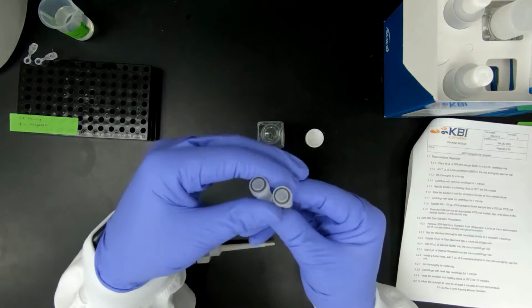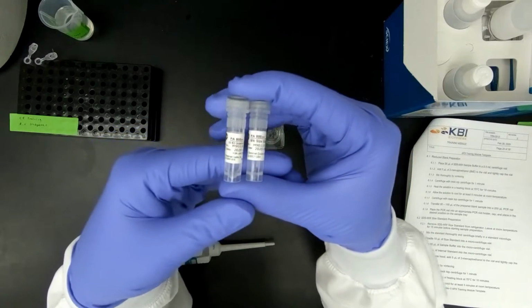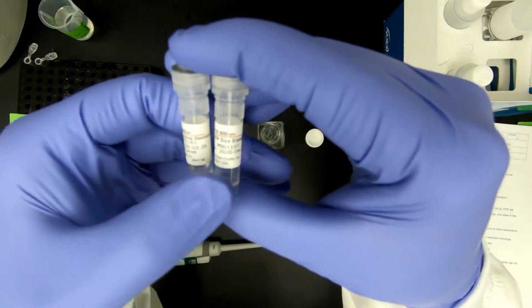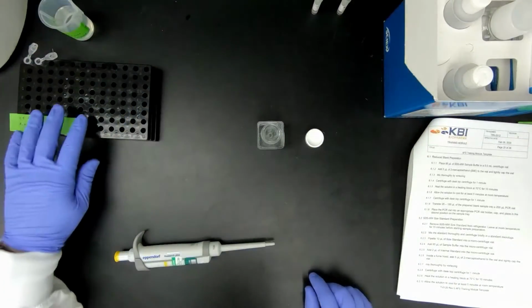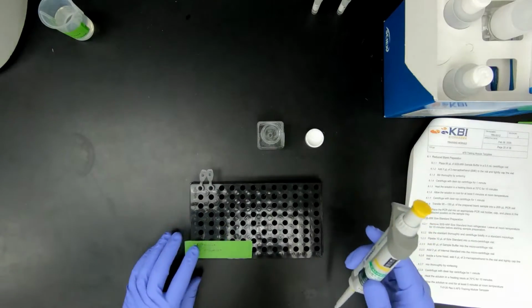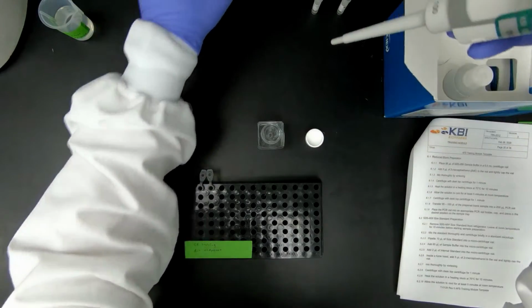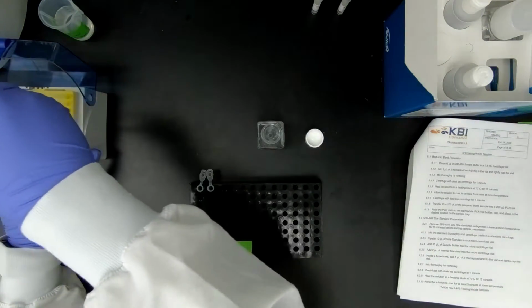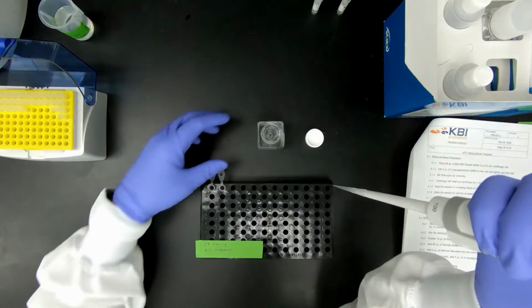The kit also, when you sign out a kit, you will need to go to the refrigerator and pull out the 10 kDa internal standard and the SDS molecular weight standard. Everyone should have also gone through basic pipette training and lab safety already.